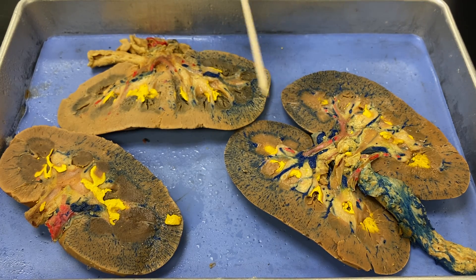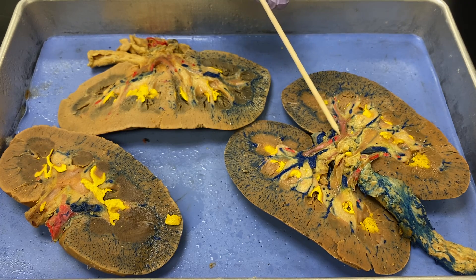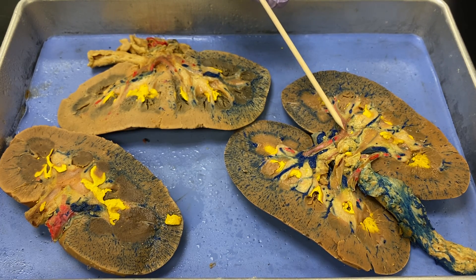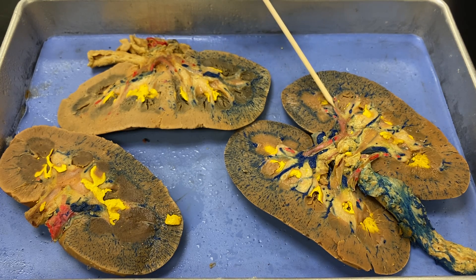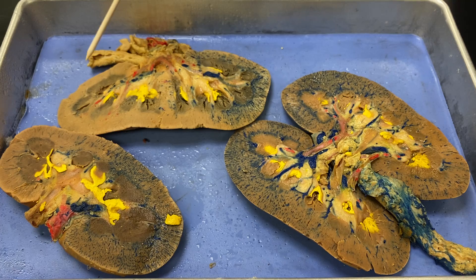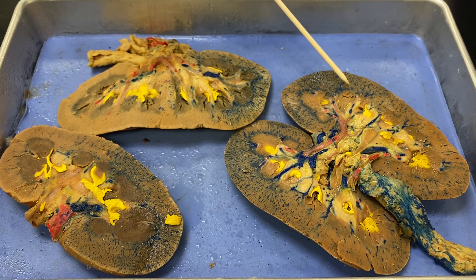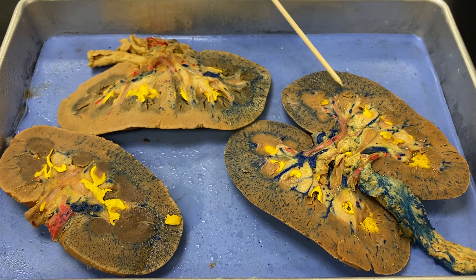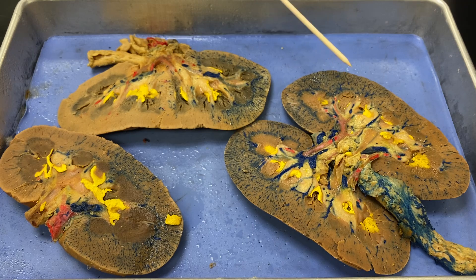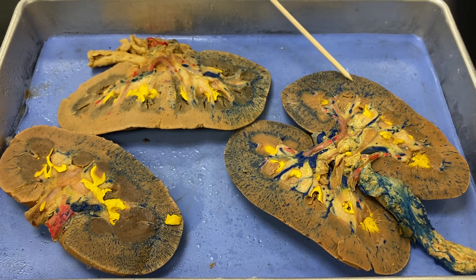We can see a couple of the arteries here. You don't see the actual renal artery, but this would be a segmental artery. These ones that come out here are the interlobar arteries. You can't really see any of the arcuate arteries, and you really can't see the afferent arterioles at all. But there are a lot of blue lines out here, which would be the interlobular arteries and veins, also called cortical radiate arteries and veins.